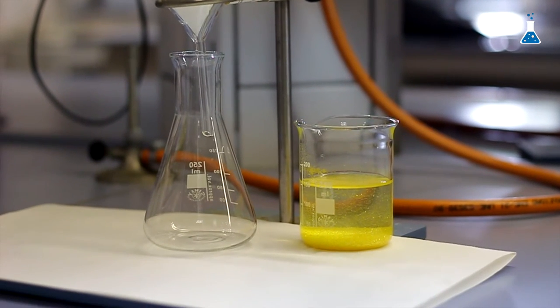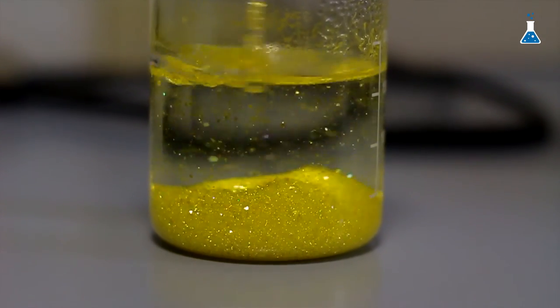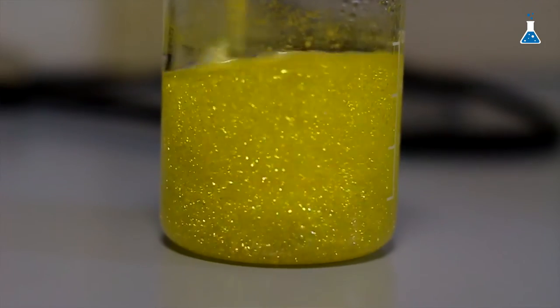The drop in temperature will cause the formation of very pure and larger crystals of lead iodide that will produce a more glittering and shimmering effect, what is usually referred to as golden rain. The process of crystallization is slow and can last up to an hour as the crystals come back out of solution. The longer the cooling process, the larger the crystals formed, and therefore you will better appreciate the beauty of the demo. Now we can observe the precipitation of the crystals — you can understand why this demo is called the golden rain. The crystals are moving around due to convection currents.